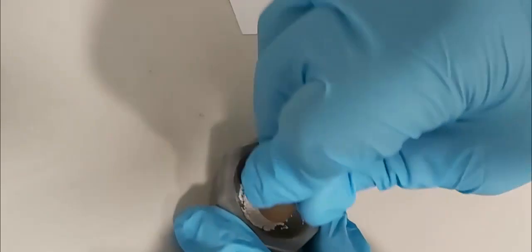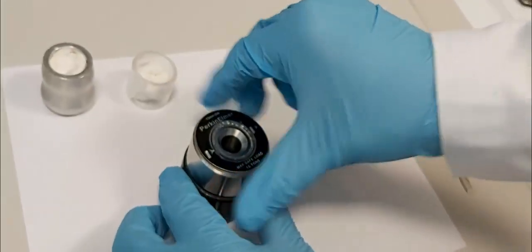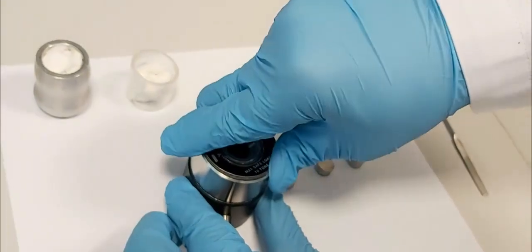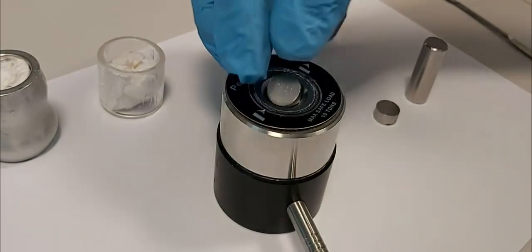Then we place the KBr in the small mortar and grind the solid until we obtain a very fine powder. Grind very well to obtain a very fine powder, as you can see.